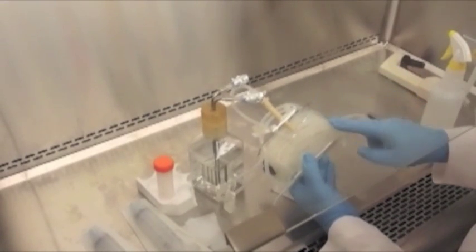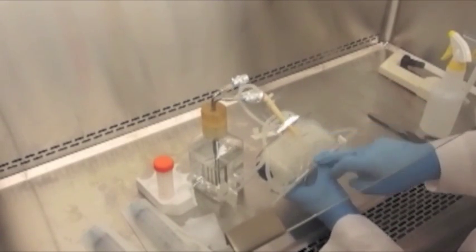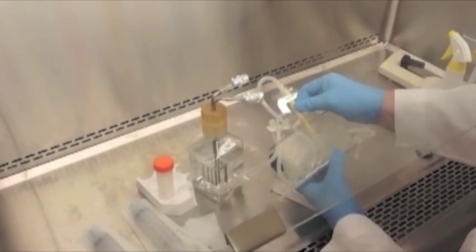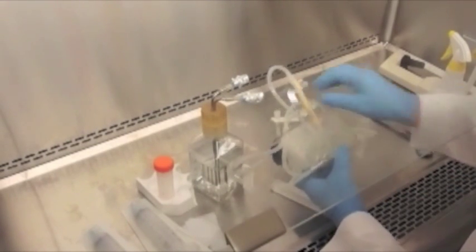Here we have our loop of silicone tubing to provide gas exchange, and we can see the two one-way check valves, which is how we generate the flow rate when the duet pump squeezes on the pump tubing.